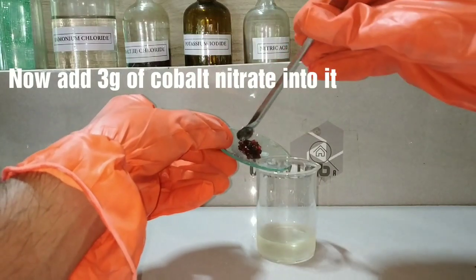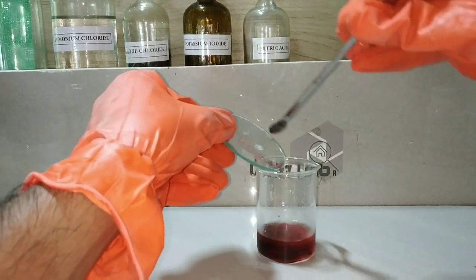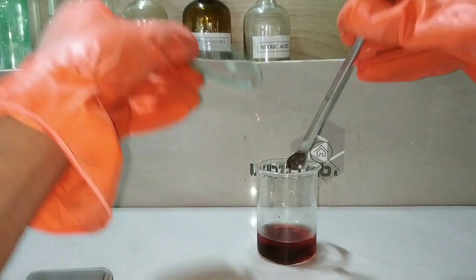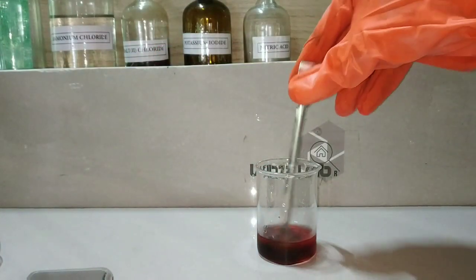Now we add 3 grams of cobalt nitrate into this solution. Cobalt nitrate has a beautiful red color to it.